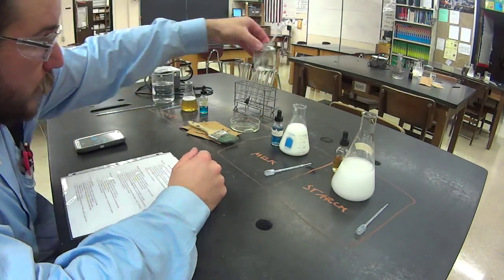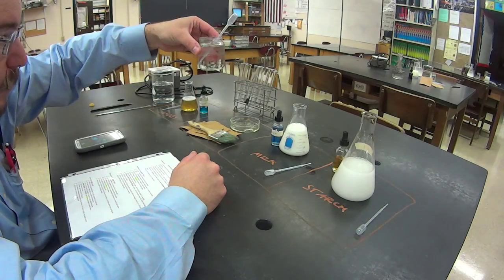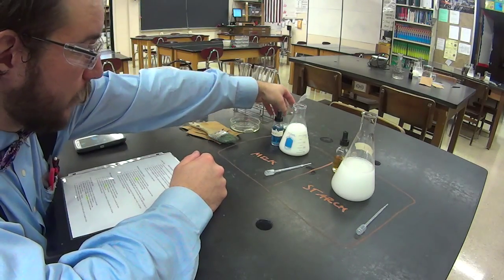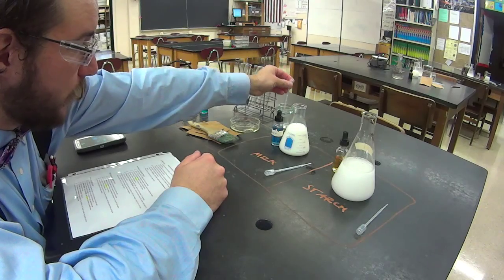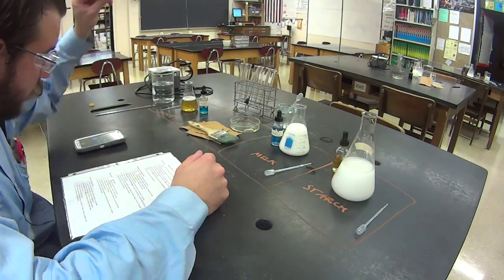For mixing in water to your unknown, use this right here. A little baby food jar with a separate pipette just for water.